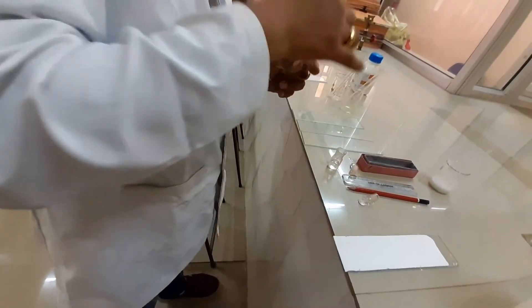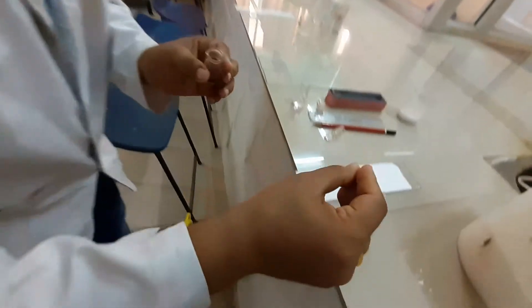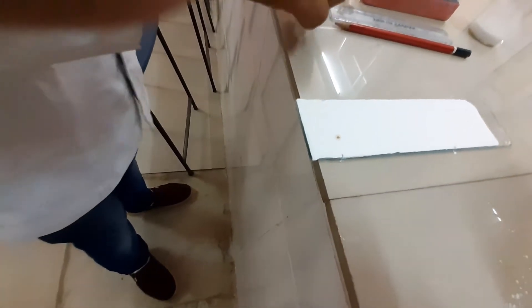The next one is the caffeine extract obtained from the tea powder. This is the tea powder extract — this is your test sample. To the right-hand side, you apply your test sample. This is the application of your test sample. Now wait for some time so that both samples are dried.